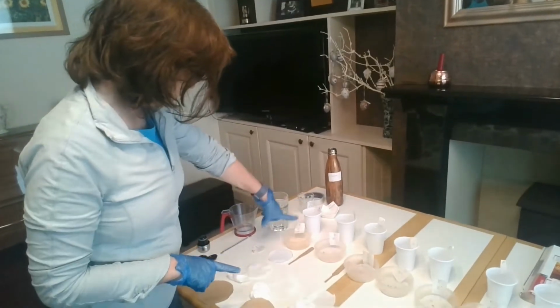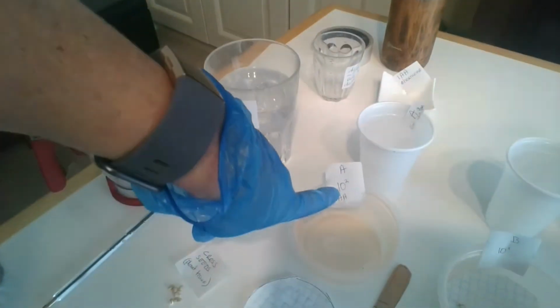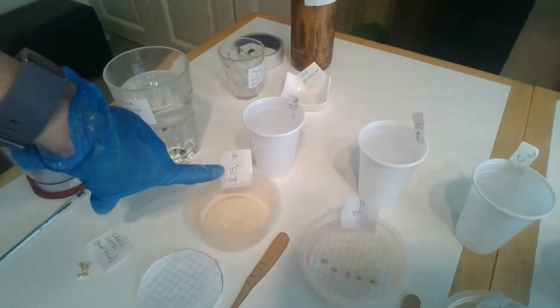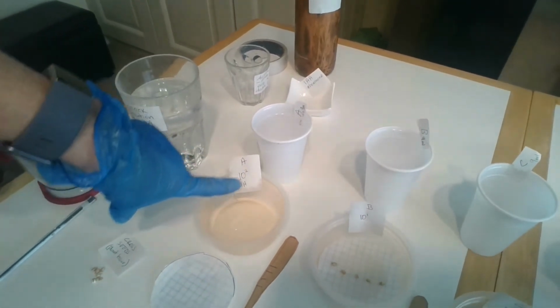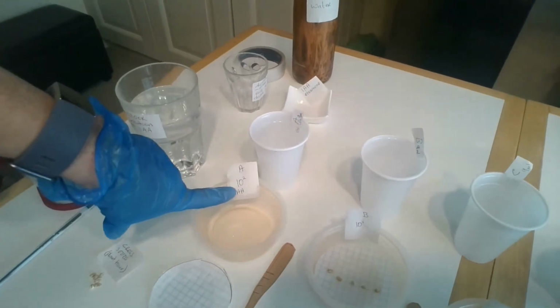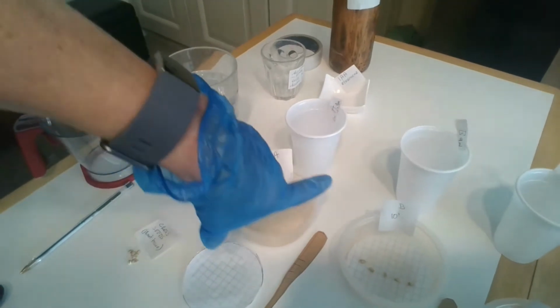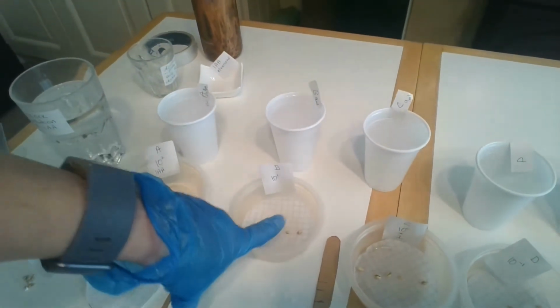Okay, now to set up the experiment, you have got Petri dishes labeled A with a concentration of IAA solution of 10 to the power of 2, well, that's just 100 parts per million. So that is the most concentrated IAA solution that we are going to be working with. If you move down, we've got another Petri dish, B, with 10 to the power of 1 parts per million.